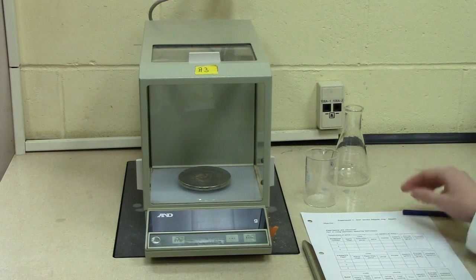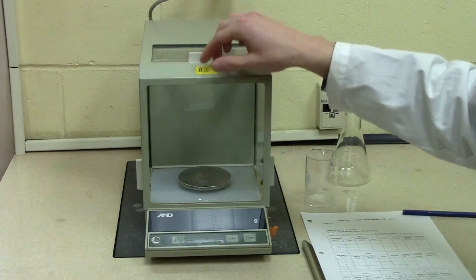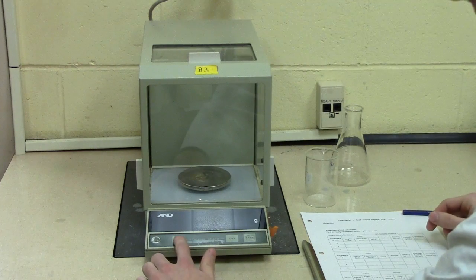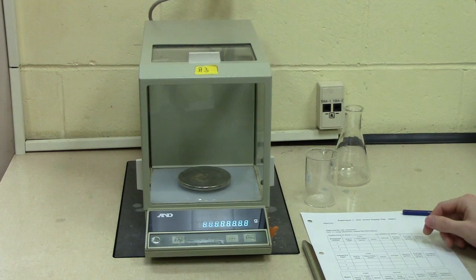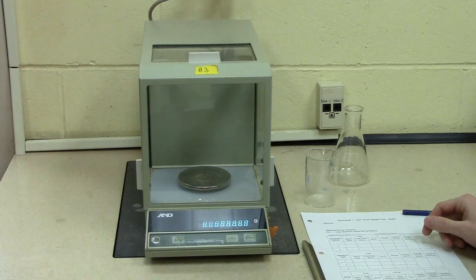When turning on the analytical balance you want to make sure that all of the glass doors are closed. The on button located at the front of the balance can be pressed and you wait until 0000 comes up.